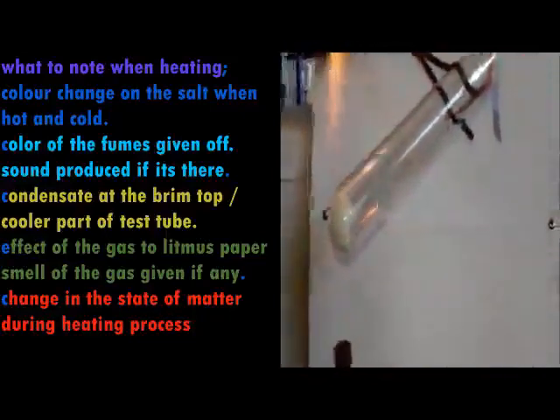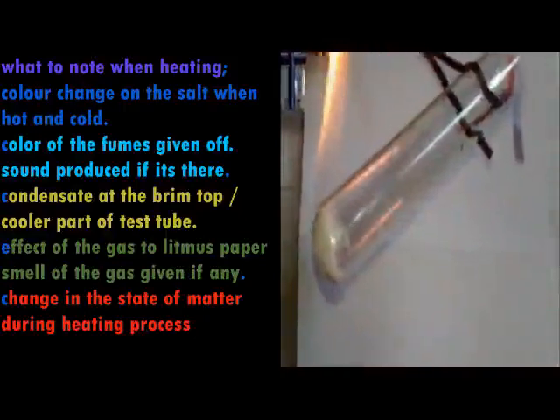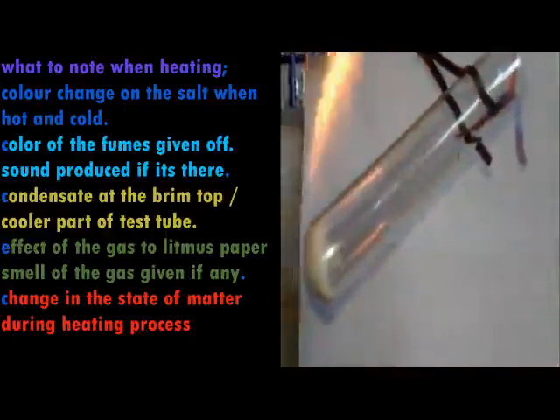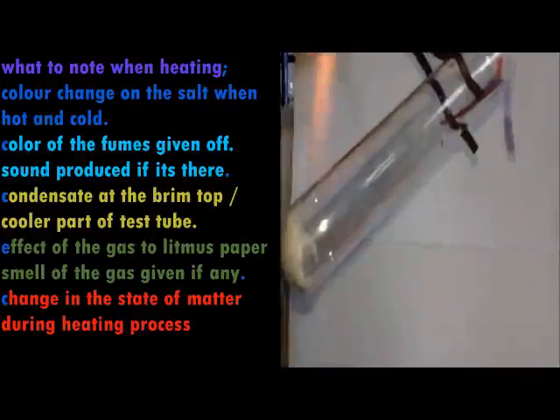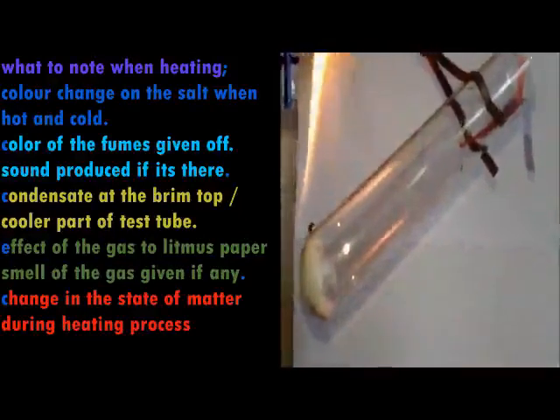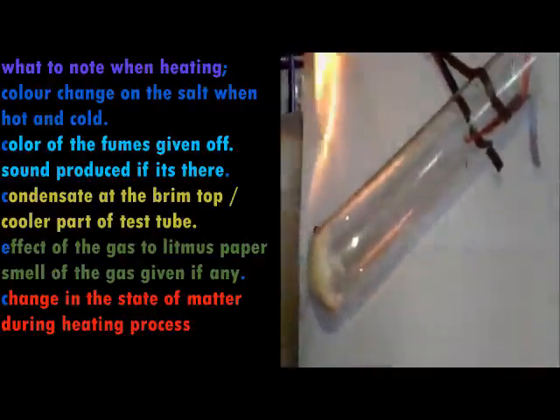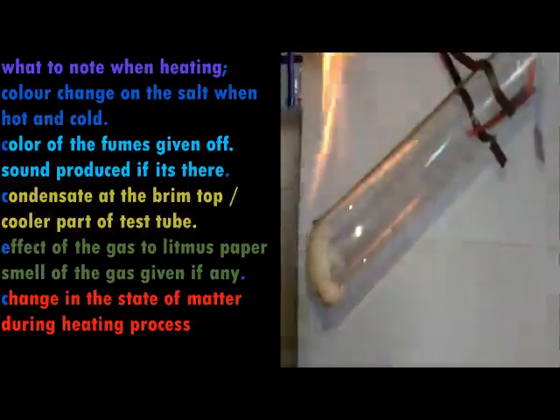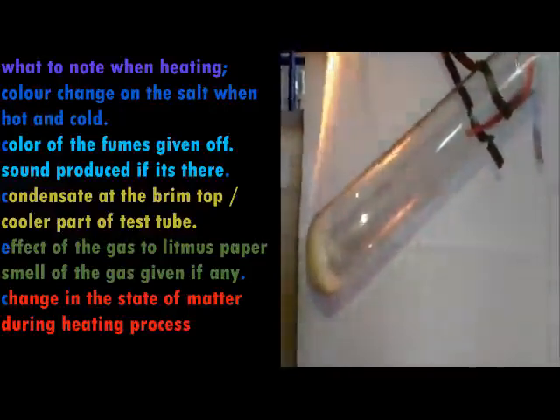Then when you are heating there, we are going to note what is happening inside the boiling tube. At one position, at the bottom of the boiling tube, then at the second position, near the top of the boiling tube. At the bottom we are discovering the color change which is occurring. Then around the top we are discovering whether something is being given off. Then we are going to discover the change which occurred in our litmus.